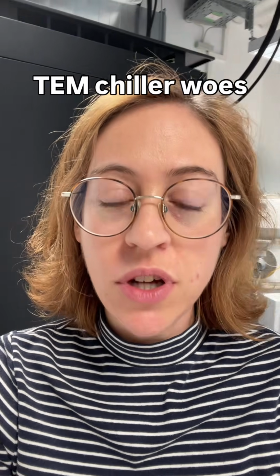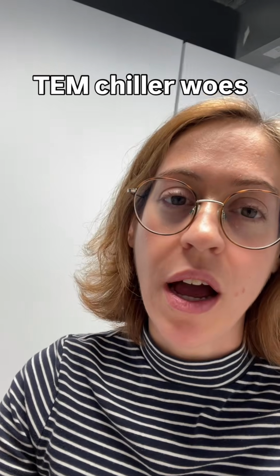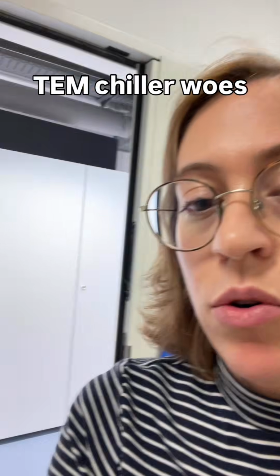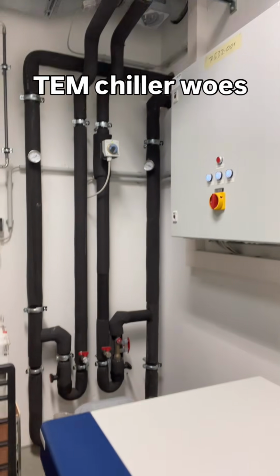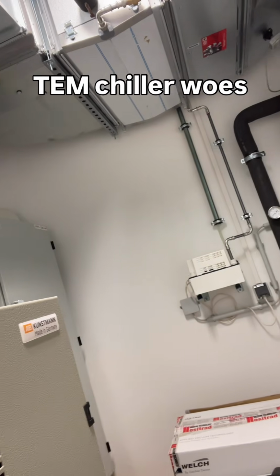So first off, our chiller shares the building's water supply with the air conditioning unit. So I'm going to move into the chiller room, which is quite loud. But here is our chiller. And then we have the pipes with the water supply and the air conditioner unit.